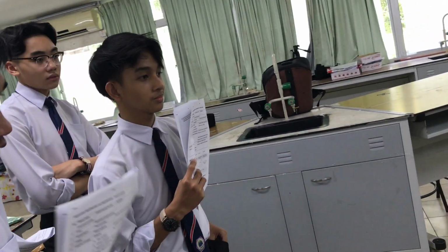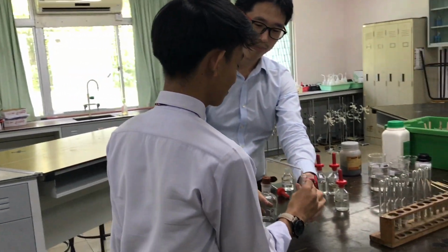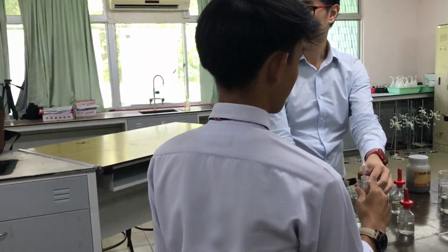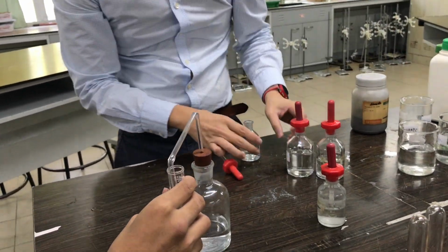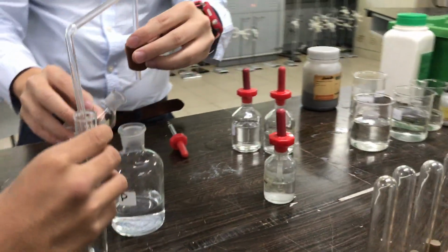So it will be like this. Yeah, come. Okay, just hold it so that you see what we are doing. I'm going to react this and produce a gas, and when the gas gets produced, the gas is going to go in there, and then you will see bubbles. Okay, so at the moment nothing. He said he wanted nitric acid, right? So nitric acid. So come and observe what happened.